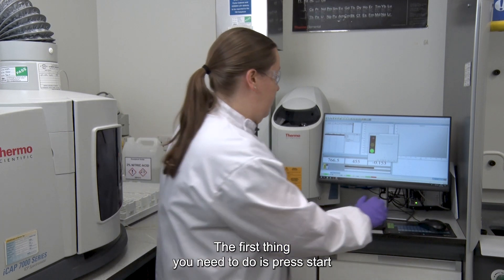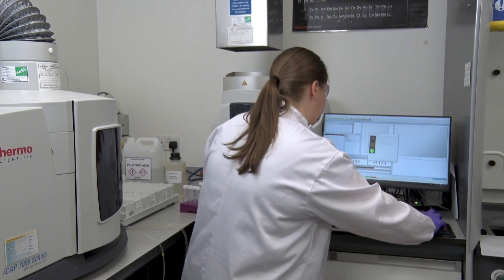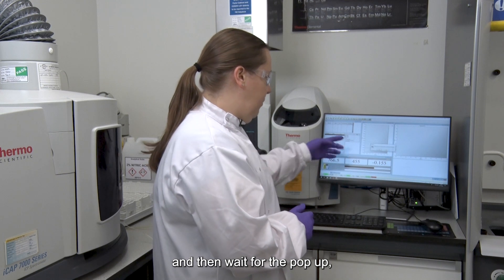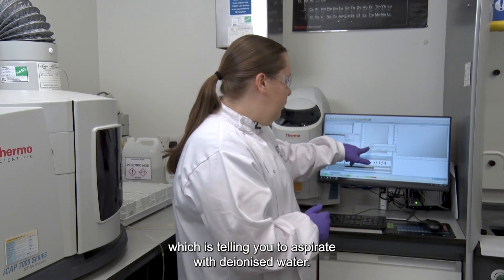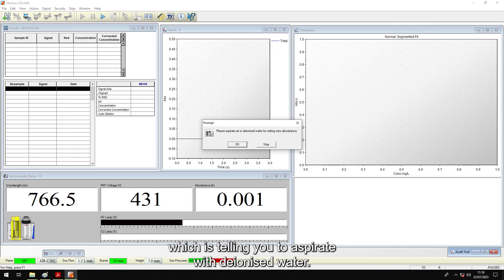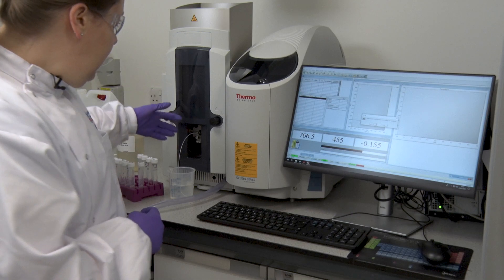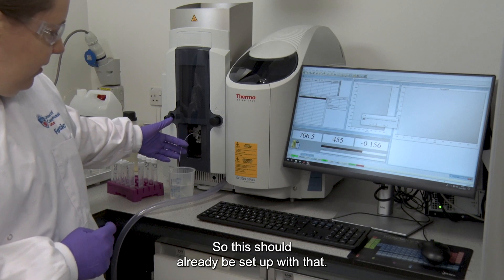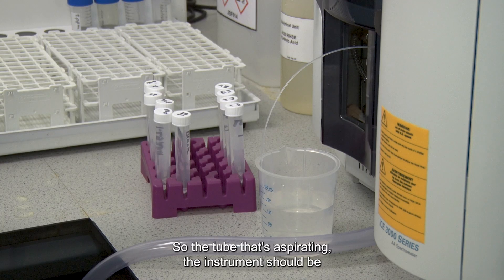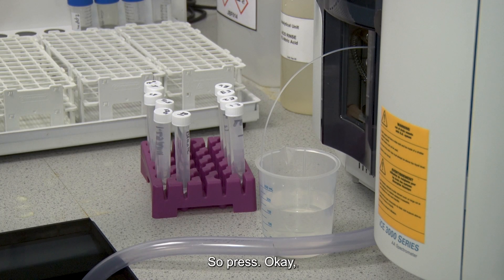The first thing you need to do is press start, and then wait for the pop-up which is telling you to aspirate with deionised water. This should already be set up, so the tube that's aspirating the instrument should be in deionised water. Press OK.